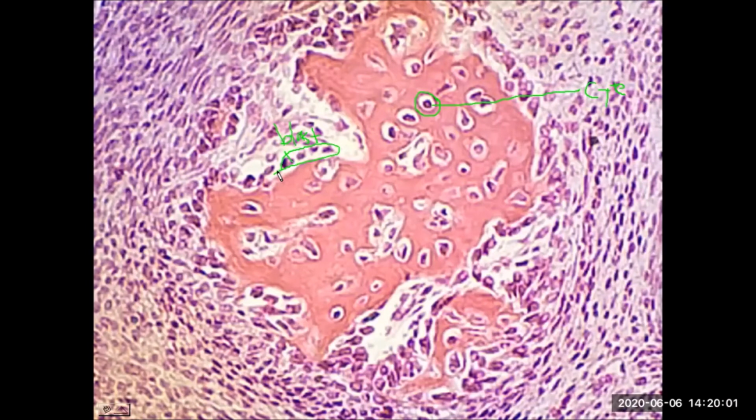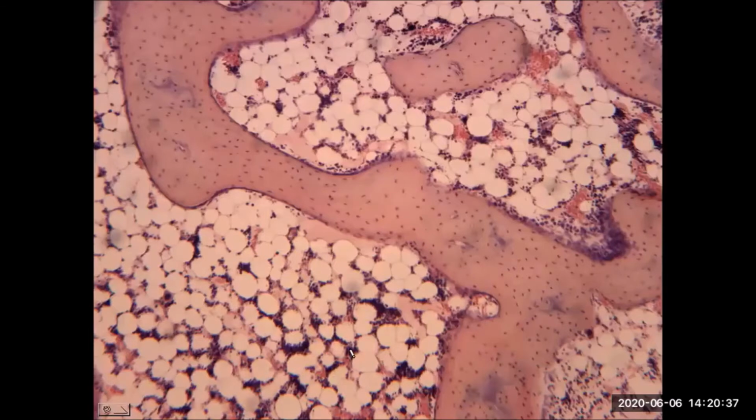So now the big difference is looking completely outside of the trabecula. Say in this area, you notice we don't see the red bone marrow. We do not see the adipose. Instead, we have just the undeveloped connective tissue stem cell. We just see a big cluster of mesenchyme. And that's the big difference. When you see a spicule just surrounded by mesenchyme, this must be intramembranous. And if we go back, when you see a spicule surrounded by adipose, this must be spongy bone.